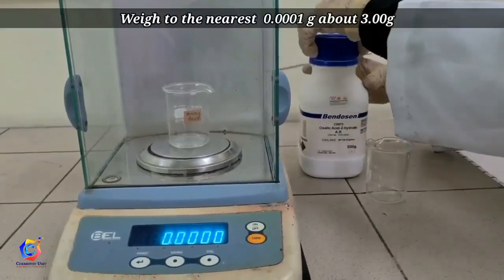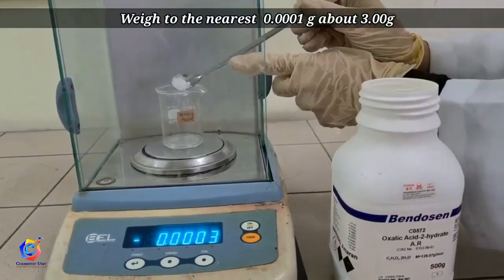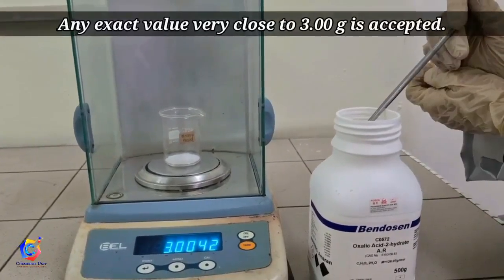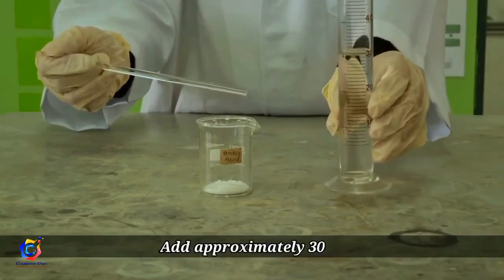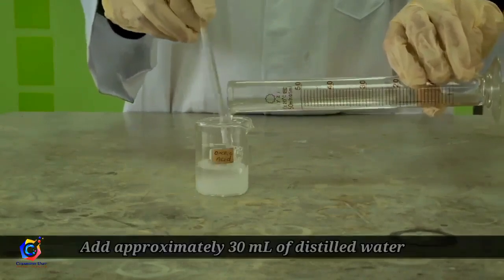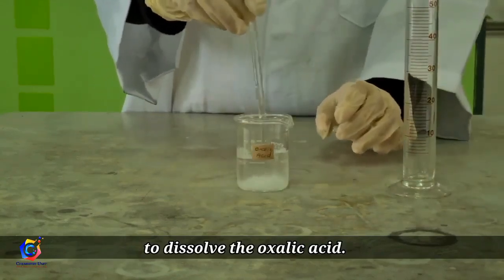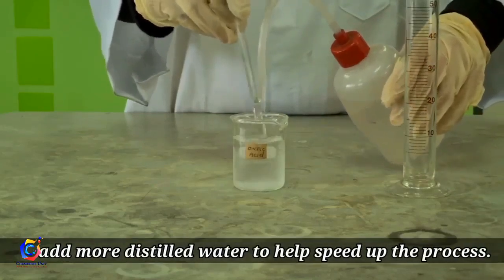Let's start experiment 2. Weigh to the nearest 0.0001 g approximately 3 g of hydrated oxalic acid using a 50 ml beaker. Any exact value very close to 3.00 g is fine. Add approximately 30 ml of distilled water to dissolve the oxalic acid. If you find it difficult to dissolve, you can add more water to help speed up the process.